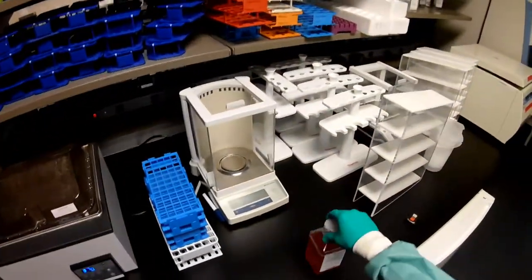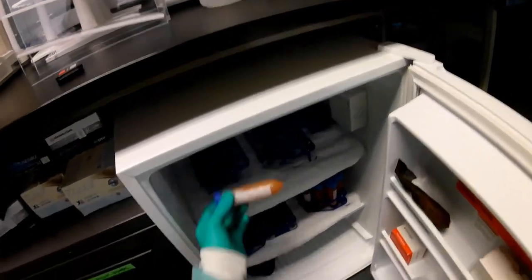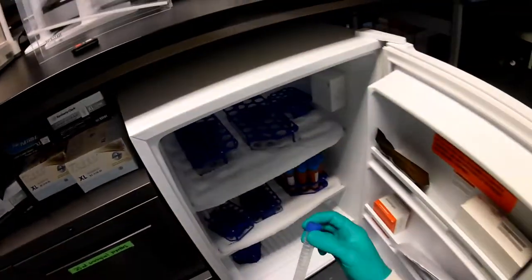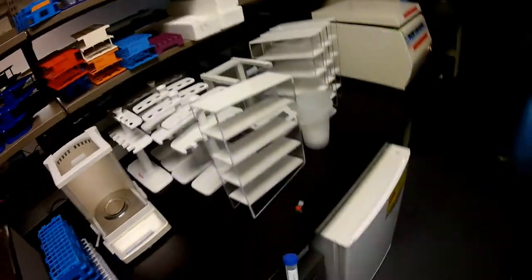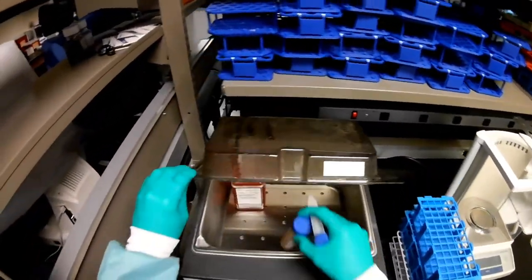Over here in the water bath, like I said, we're going to warm up our media, which I already got out of the refrigerator. The other thing we need to warm up to make our media is some bovine calf serum and some penicillin streptomycin antibiotic solution. So I'm going to put these in here as well.